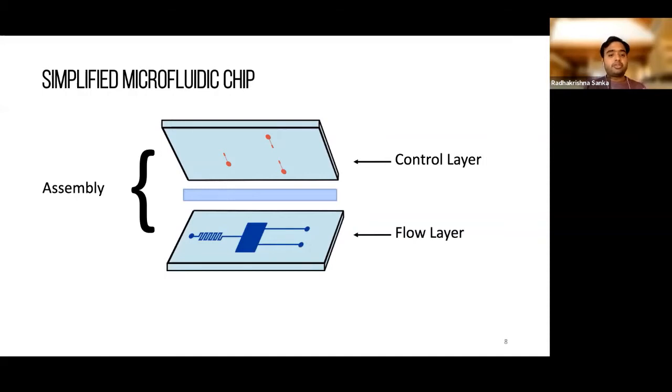So a simplified microfluidic device at the most easy level is basically an assembly of 2-3 different pieces, 2-3 substrates. The color code I use throughout this entire workshop and in 3DuF is that all the geometries you see in blue color are what we call the flow layer. The flow layer is where your actual science, your protocol, or your assays are executed. And the control layer is essentially the little pneumatic infrastructure which you use to control how the fluids flow in the flow layer.